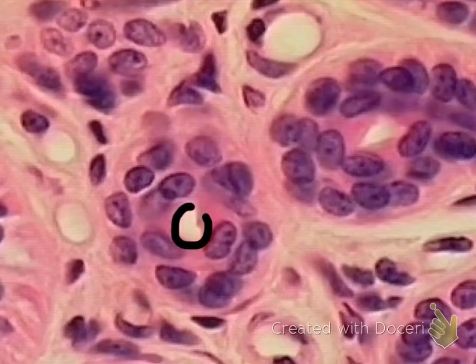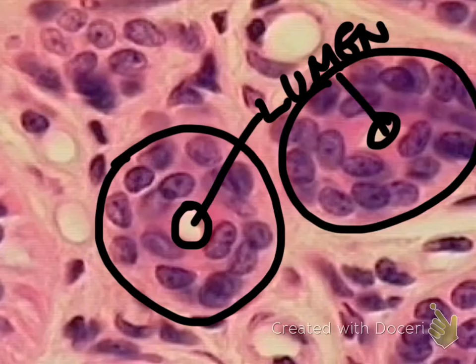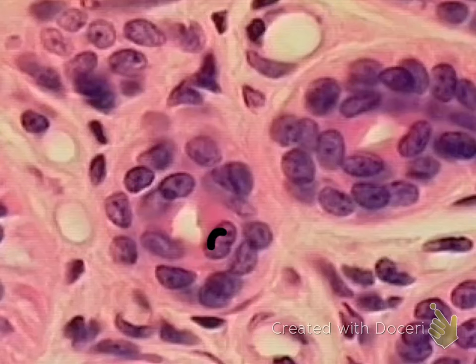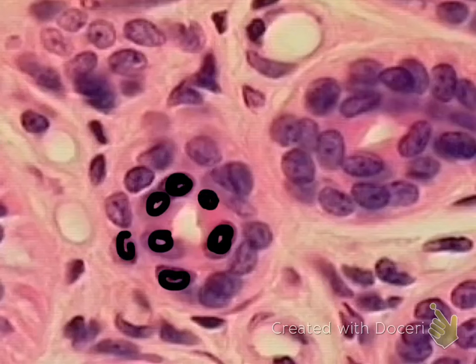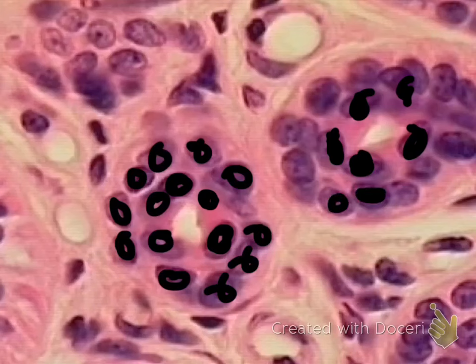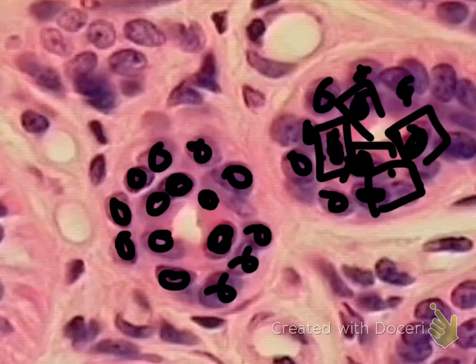This is your apical surface, and the space inside is called the lumen. This is your basement membrane. The epithelial tissue here looks almost like a donut shape. Notice that the nuclei are almost oval but more round. Here's one layer of round nuclei, here's another layer of round nuclei — multiple layers of round nuclei. You're looking at square-shaped cells, so multiple layers of square cells. This is your stratified cuboidal epithelium.